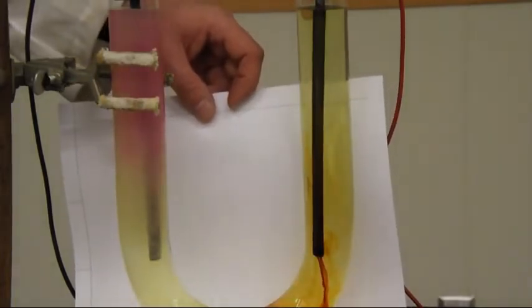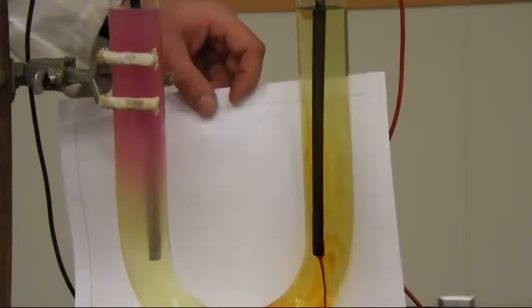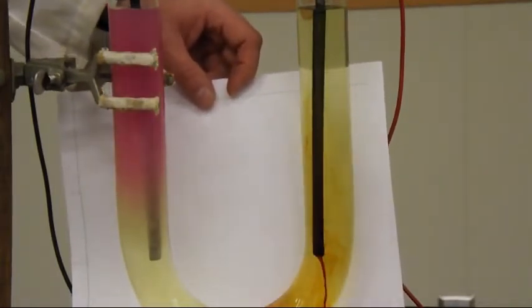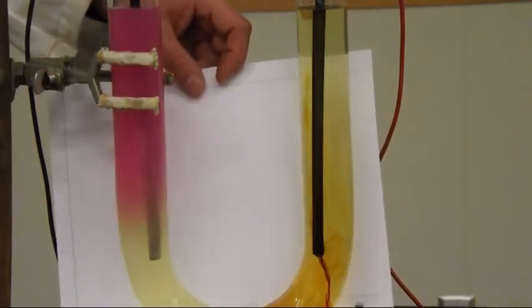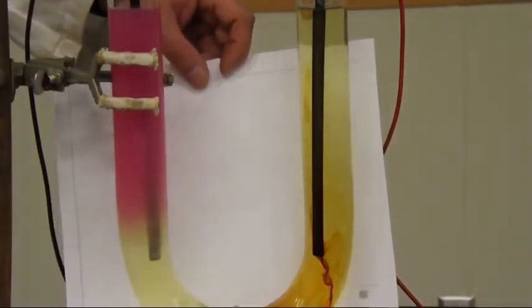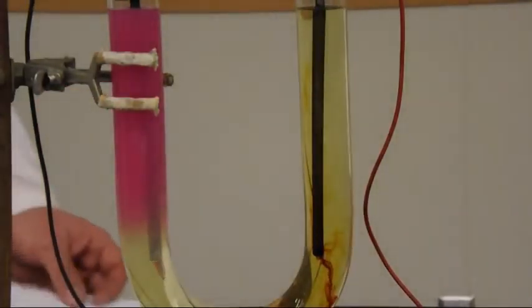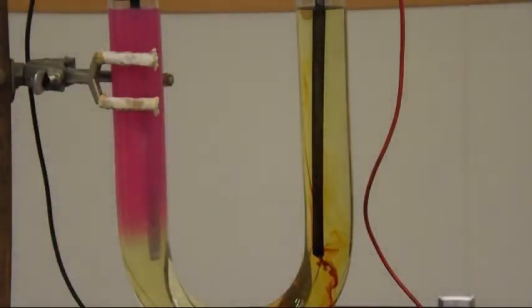So what most likely is being formed there? I minus is what we start with. This is I2 that's being formed there. So basically, and now look at the coloration over here. We have a pink color being formed there. That was the acid base indicator indicating that we've got a basic solution now being formed.